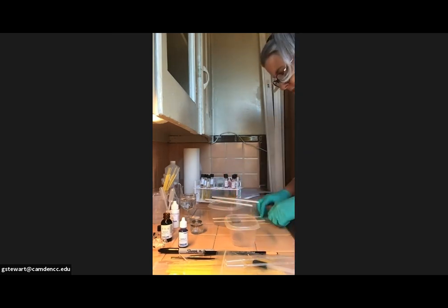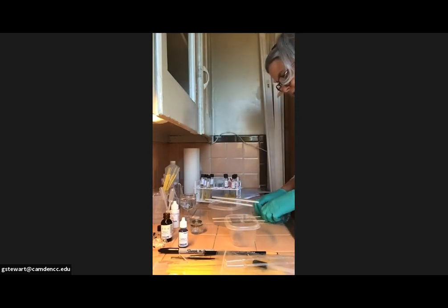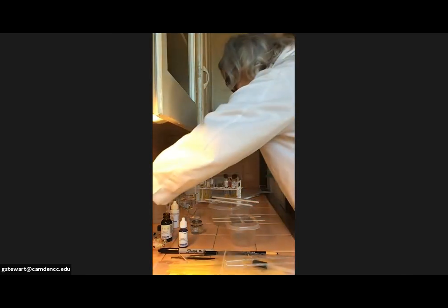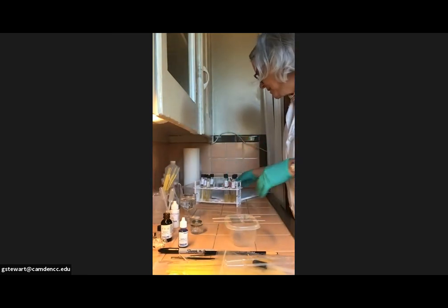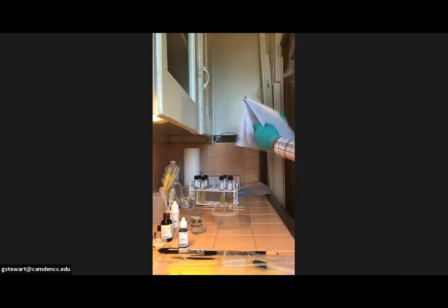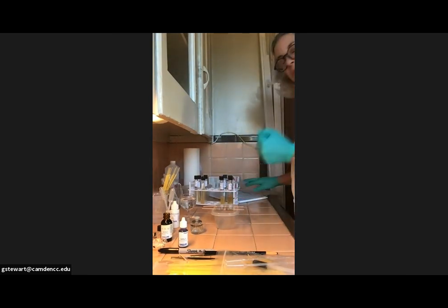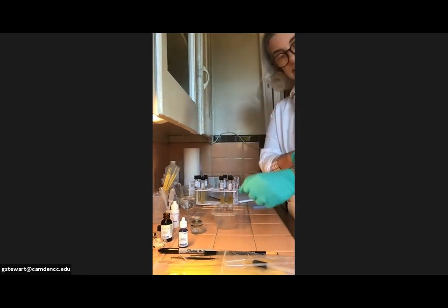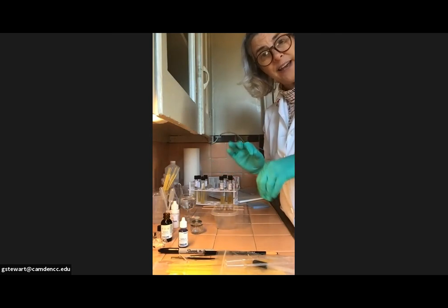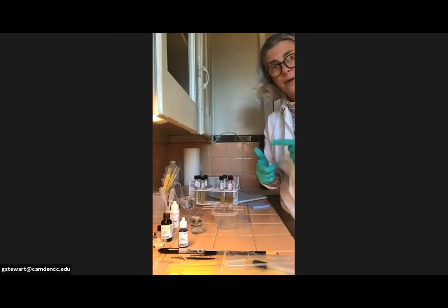I think for our simple stain, I can probably just get away with this because I'm only going to have 2 slides instead of 3 because I don't have any methylene blue. All right. Get out a couple slides, put the rest of the stuff to the side. I would strongly recommend a couple of other things. I have already written out the procedure on some paper over here, like as if it was my lab book, and I have that where I can easily see it. You're going to need a timer of some sort. I'm going to use my watch with a second hand because I don't want to touch my phone with my hands after I've been handling bacterial cultures, but that's totally up to you. You can use your phone. I would set the timer for a minute, and then you'll be able to just reuse it over and over again.